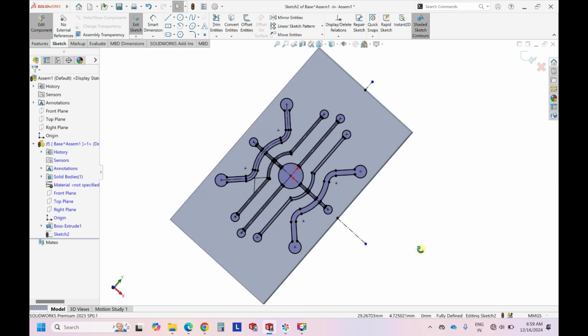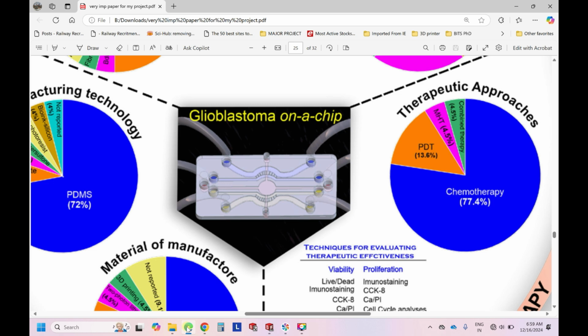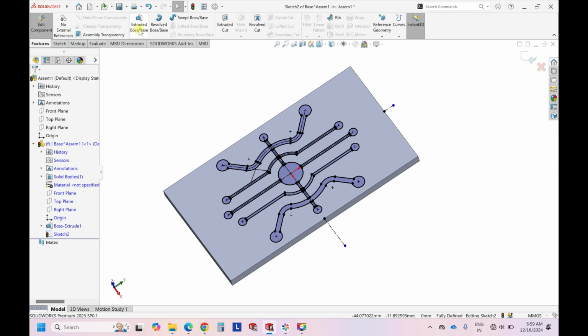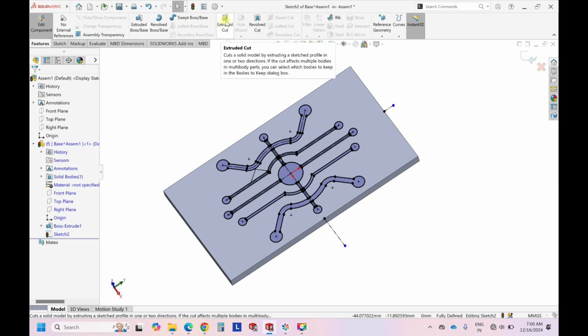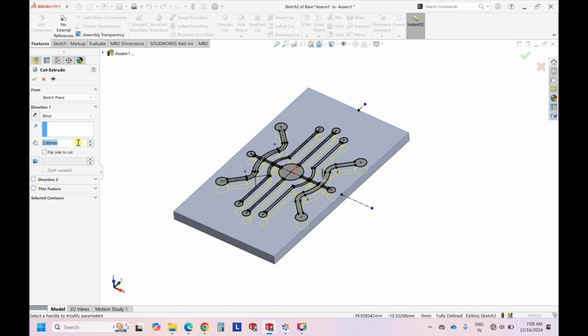So this is how the complete microfluidic channel was there in this pattern. So this picture is a copy or a representation of this design. Okay, so once you have all this ready, go to features. So there are two things. If you are planning to do this with soft lithography, then channels should be extruded out. But if you want to develop this by 3D printing, then channels should be extruded cut. So this video was for 3D printing, so we'll extrude cut it. And we can extrude it to 1 mm or 0.5 mm depending on the printer capabilities.